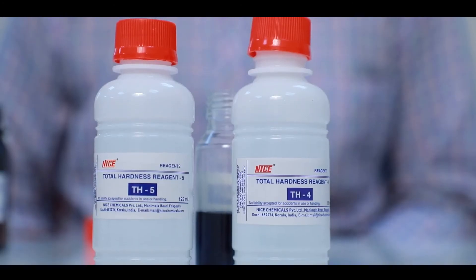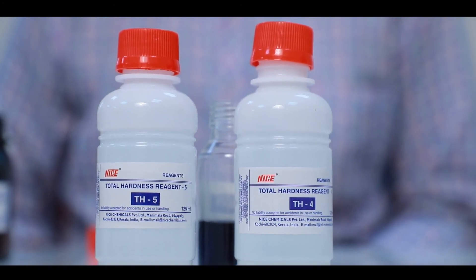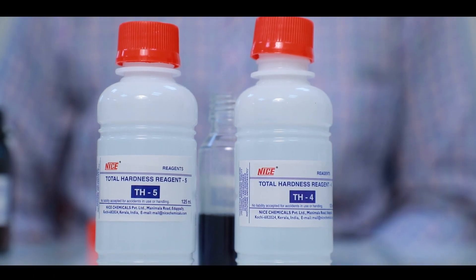For hard water we can use Total Hardness Reagent 5. Total Hardness is equal to number of drops into 50 ppm.